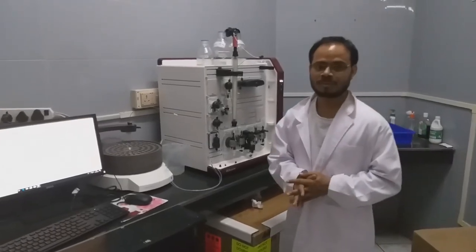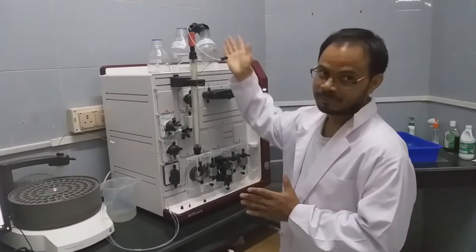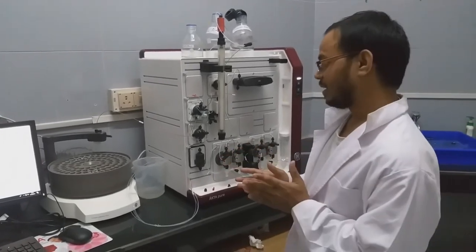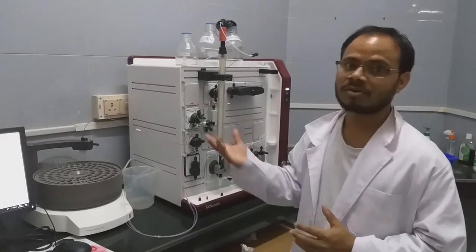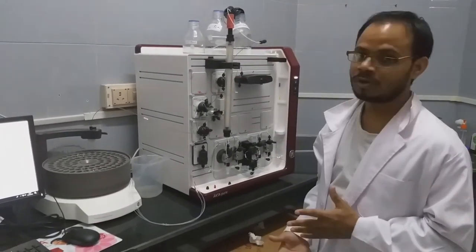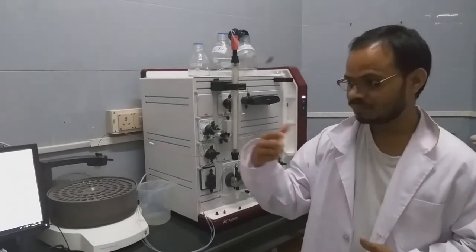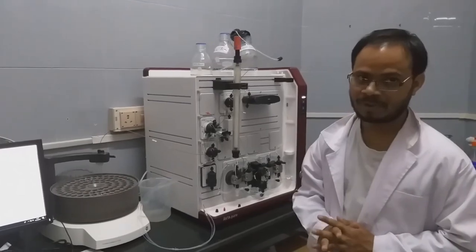All these features will familiarize you with how the system works with fast protein liquid chromatography. After using the instrument, we have to change from buffer to water first, because if you directly store the column in 20% ethanol while salts and proteins are still present, they may precipitate and clog the column. The correct practice is: first change the buffer system to water, wash thoroughly to remove all salts from inside the column, and then change to 20% ethanol for preservation. That needs to be remembered for better performance of the system.